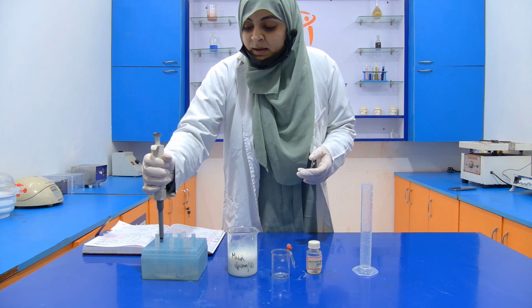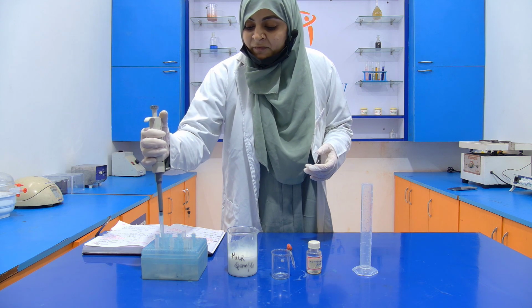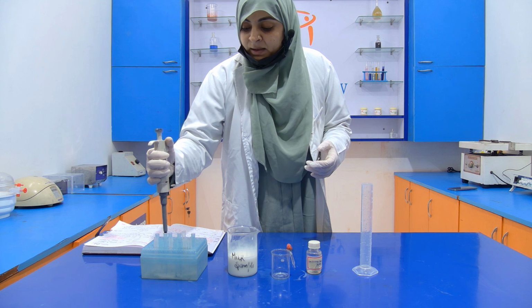First of all, I am going to take 5 ml of natural milk.